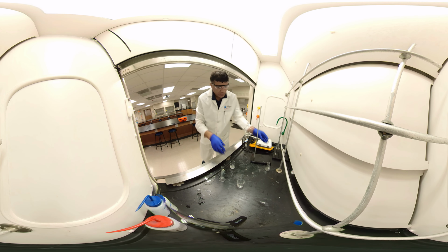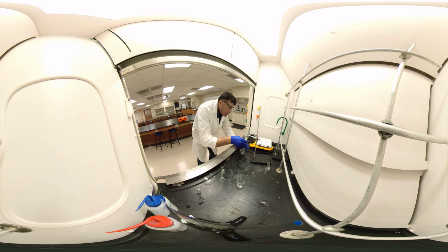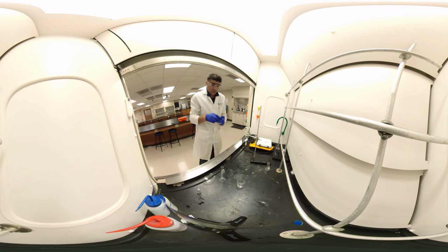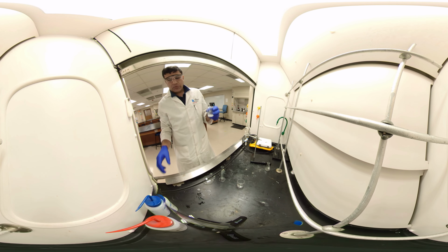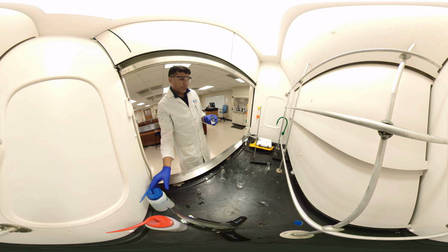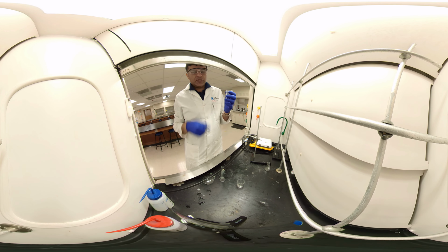Okay, so here the second portion I'm putting back to the top layer, that's the extracted aspirin. Everything is soluble, right? Everything is soluble. So liquid. So what do we do? This is deprotonated with the base.